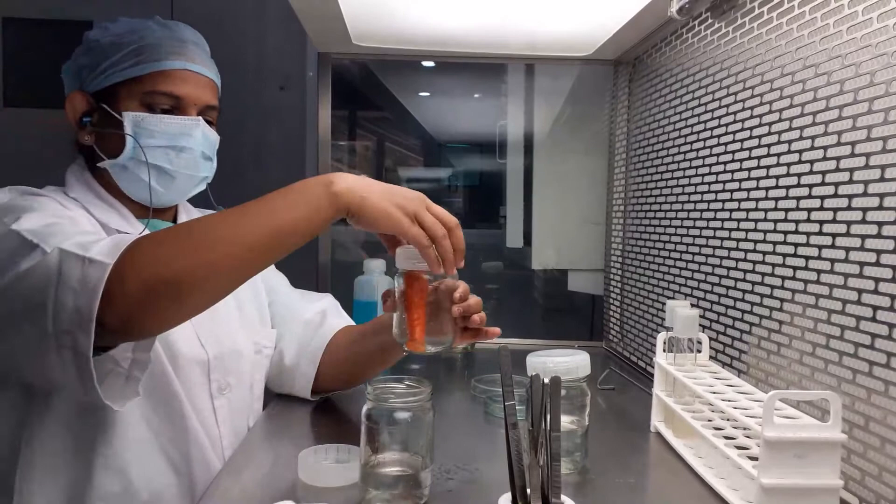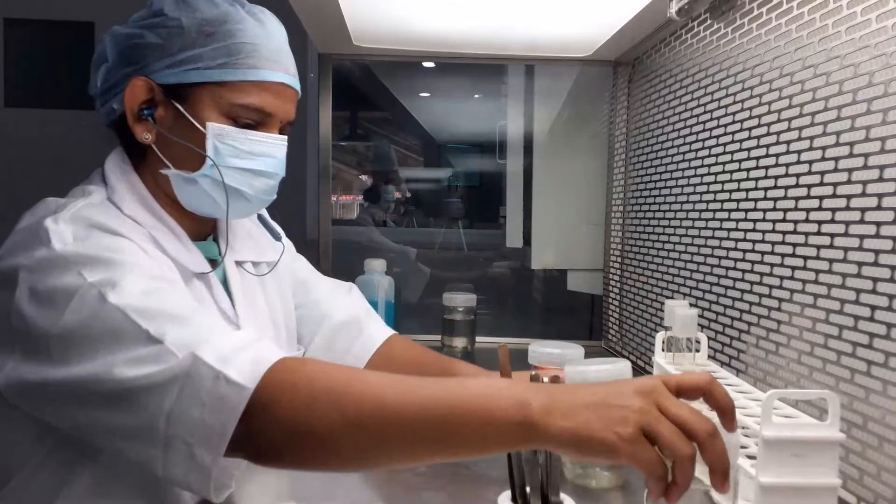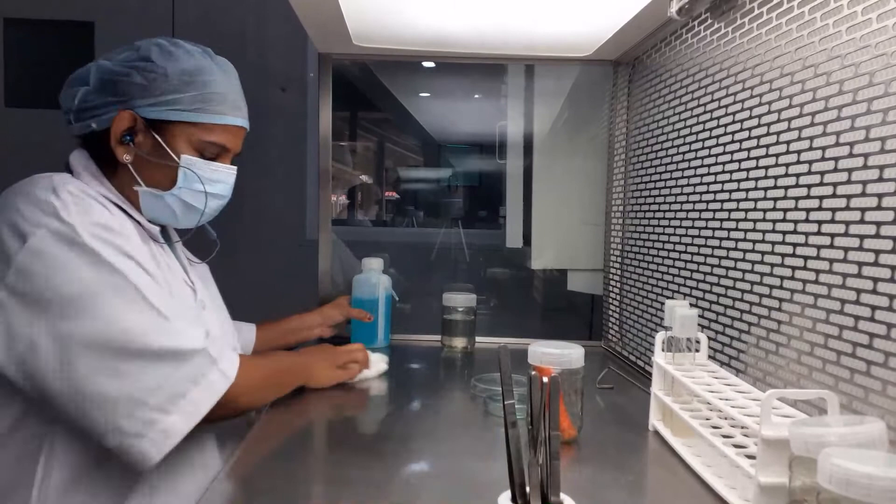Now your explant is ready to be further trimmed. You have to wipe out the entire bench with the sterilizing solution.